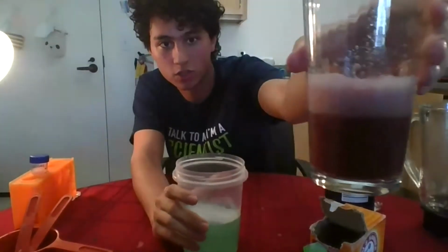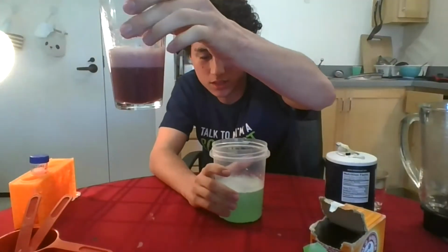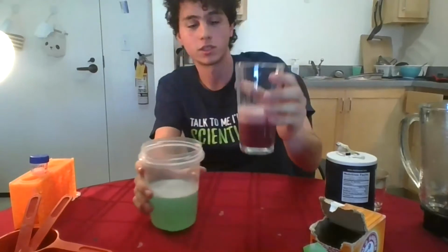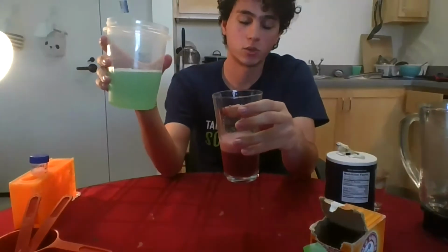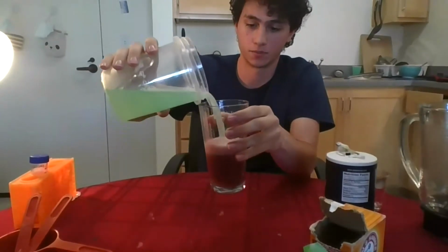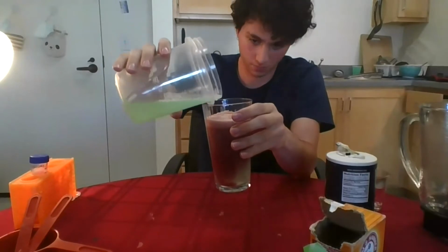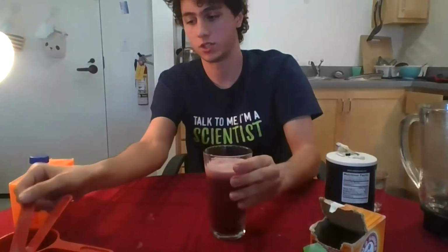Perfect. Okay, so I'm going to spotlight myself so you can see me better. Here is the liquid. There is no more bubbling towards the bottom, and you can tell that it's darker. Hopefully you can see with the light that it's darker on the bottom. And so that's what we want. Now we're ready to add the extraction mixture that we made earlier, in equal parts. So there is this much volume of strawberry blend, and we're going to add as much volume of extraction mixture. I think that's about it. Now that this is added, we're going to stir it, just like before.